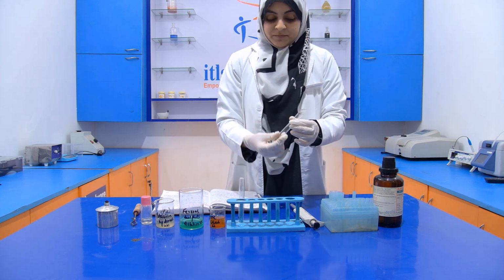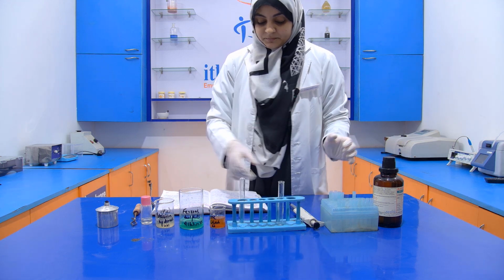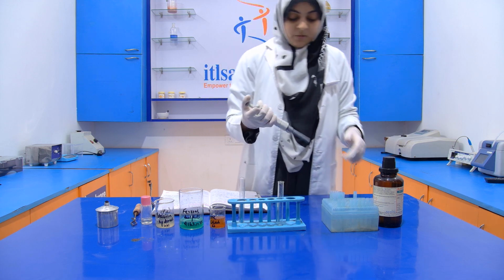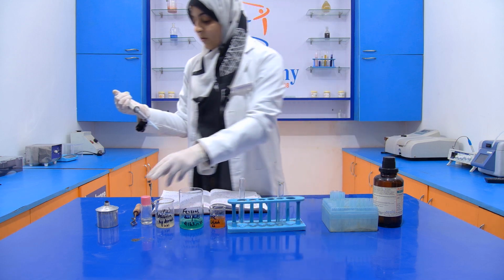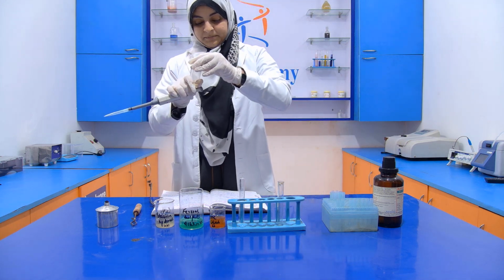Now take a test tube. After that, we have to add 3 ml of the sample. Now take it.